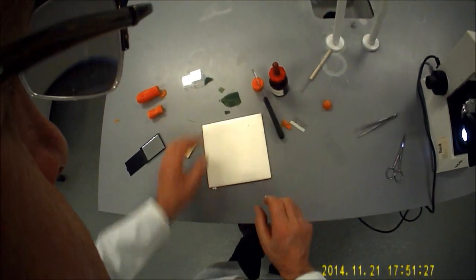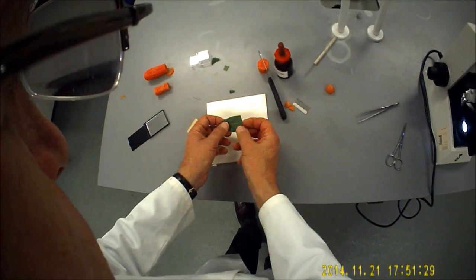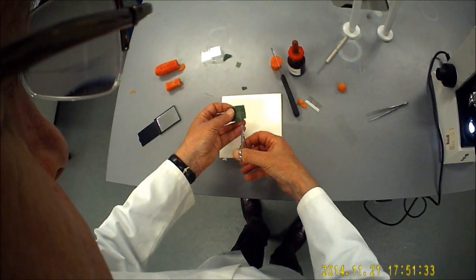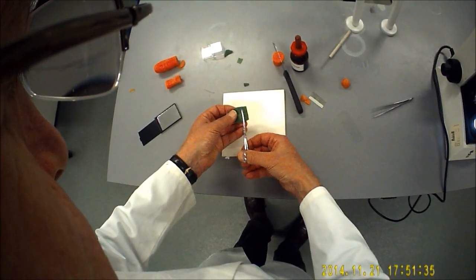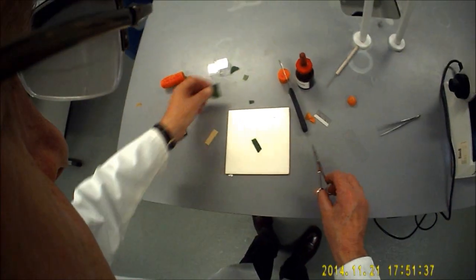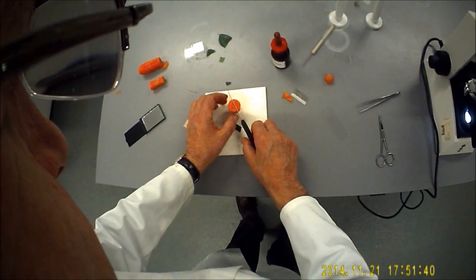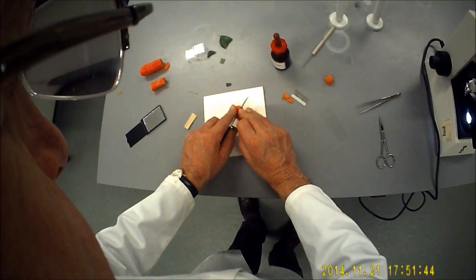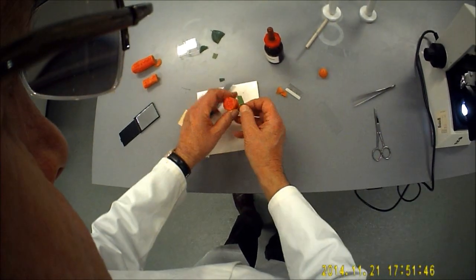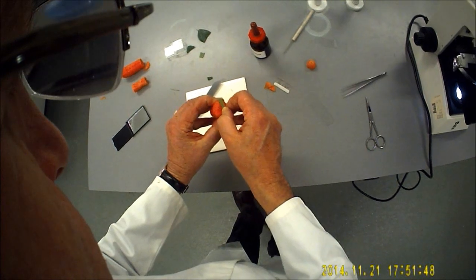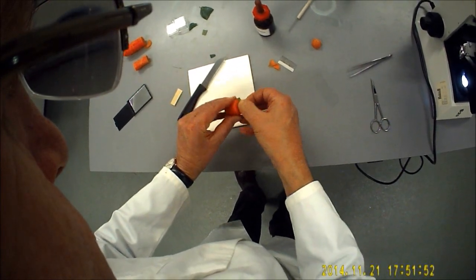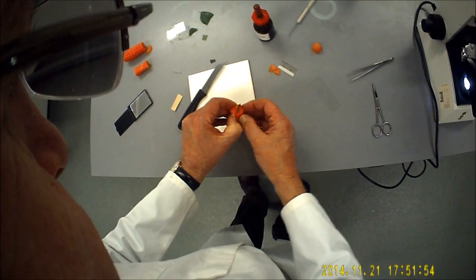We need to prepare a little bit of the leaf. We're going to need a tiny bit because we're going to reduce it in size. So here's our carrot vice, here is our leaf. We're going to insert the leaf into the carrot like so, a little bit of persuasion there, and it should pop in nicely.